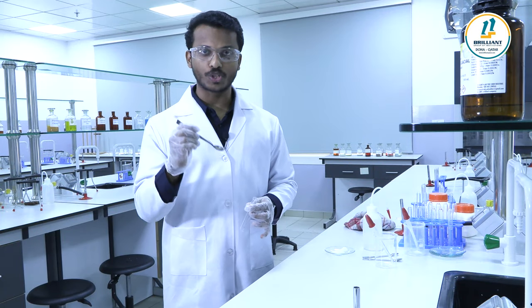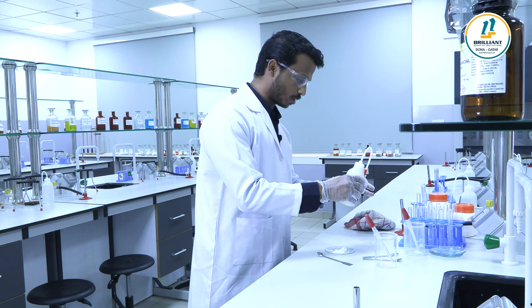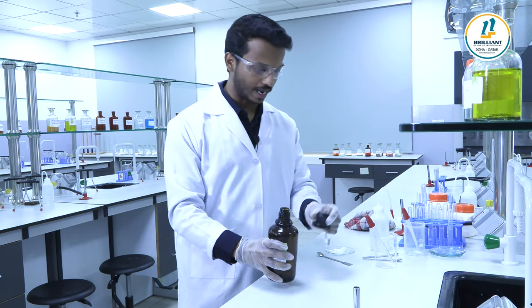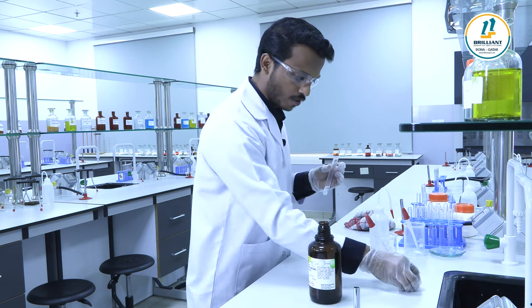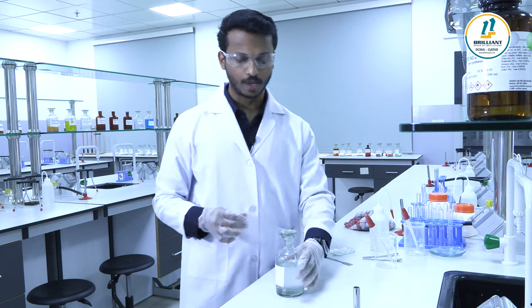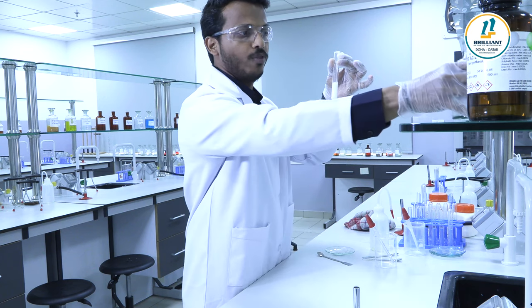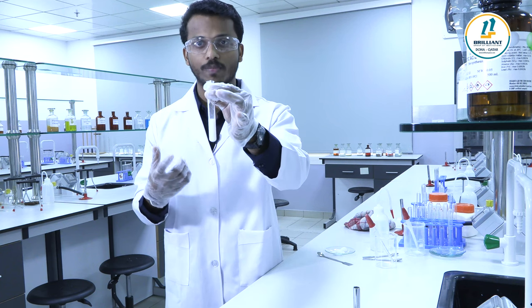Now the confirmatory test for strontium from group five. To a little of salt solution, add 2-3 drops of concentrated acetic acid. Then add ammonium sulfate solution. A white precipitate forms — that is strontium sulfate — indicating the presence of strontium in the given salt.